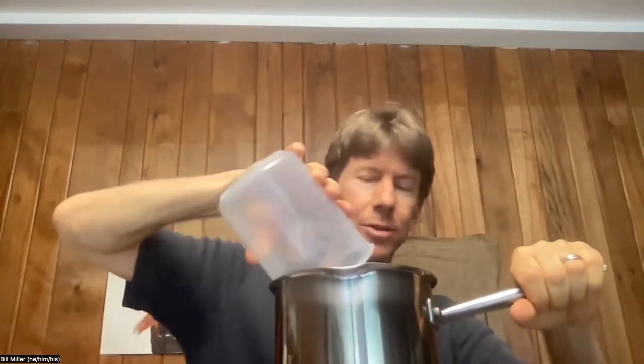I'm going to pour my water into my pot. You can use a kettle or an electric kettle or what have you. I have the top here, so that'll keep in heat as it heats up so that the next part will be as fast as possible.